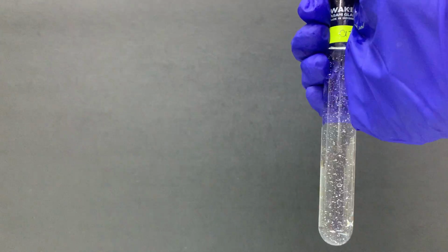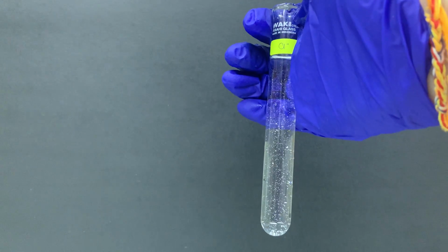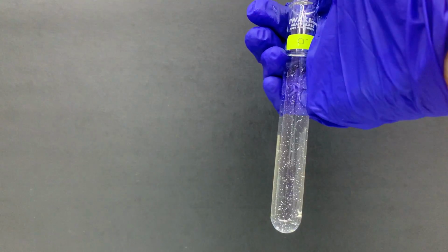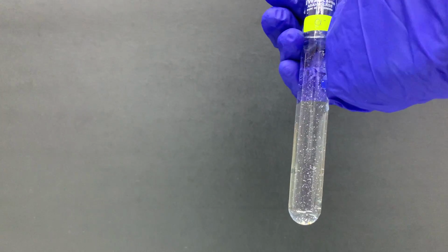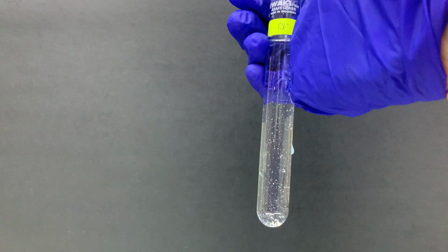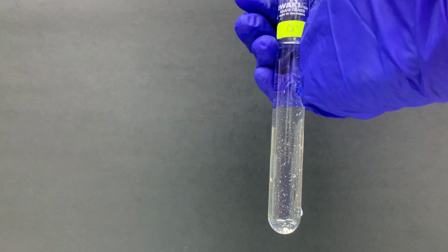So when you do this experiment for your paper 3, you actually can leave it aside for a moment. Then you can come back again and observe it again. But if you get something like this, which is considered soluble in excess ammonia, and if you're not so sure what is the identity of this halide ion, basically at this moment, you can confirm that it is chloride ion.